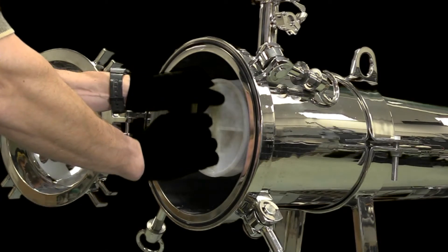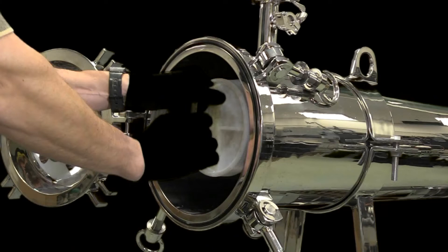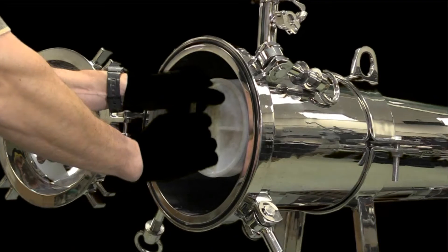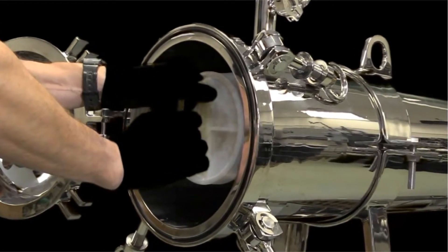This will happen after roughly one quarter turn. The filter is now locked in place and ready for use. To ensure this, gently pull back on the filter without turning the handle.